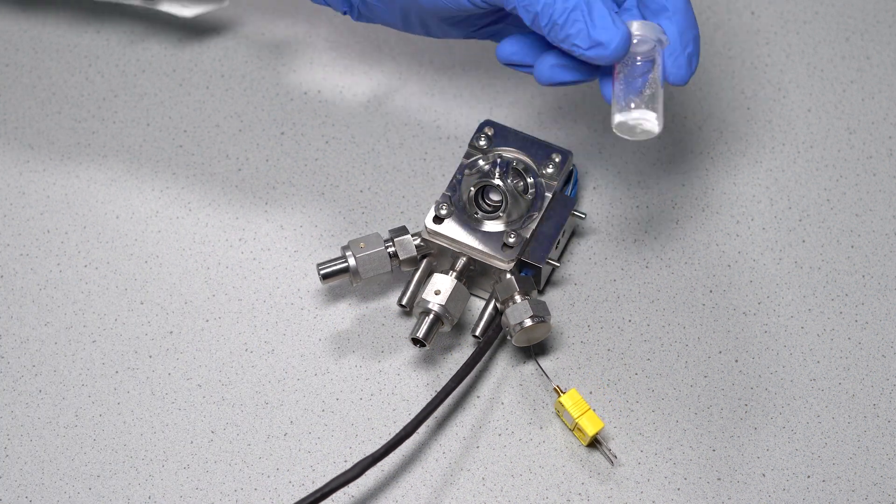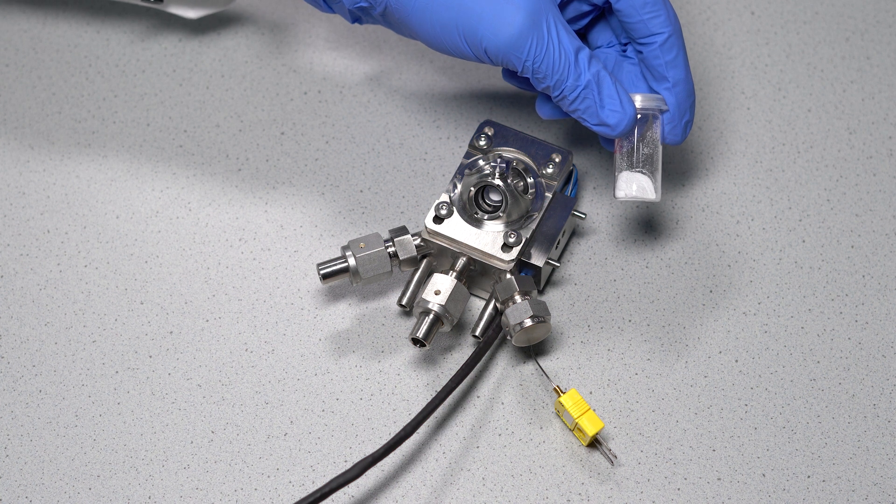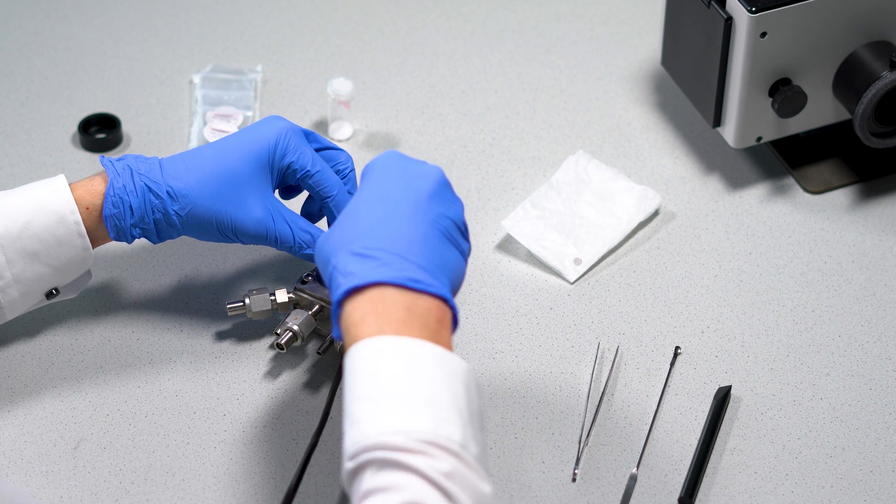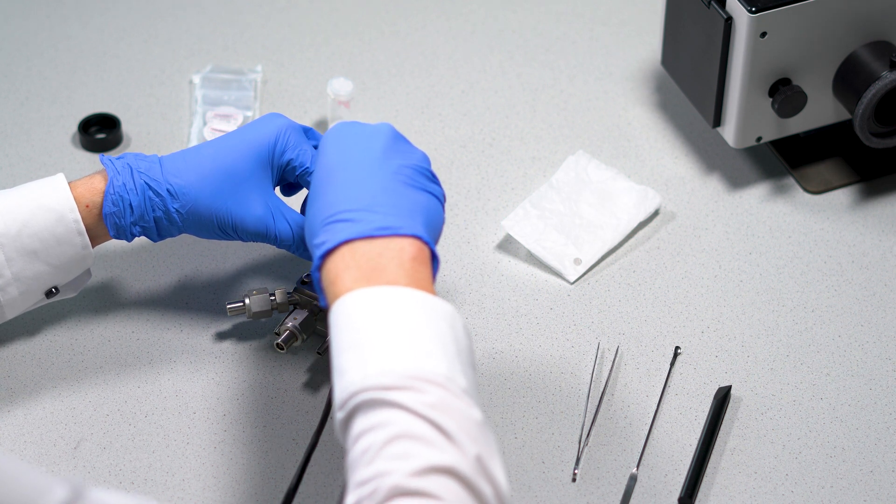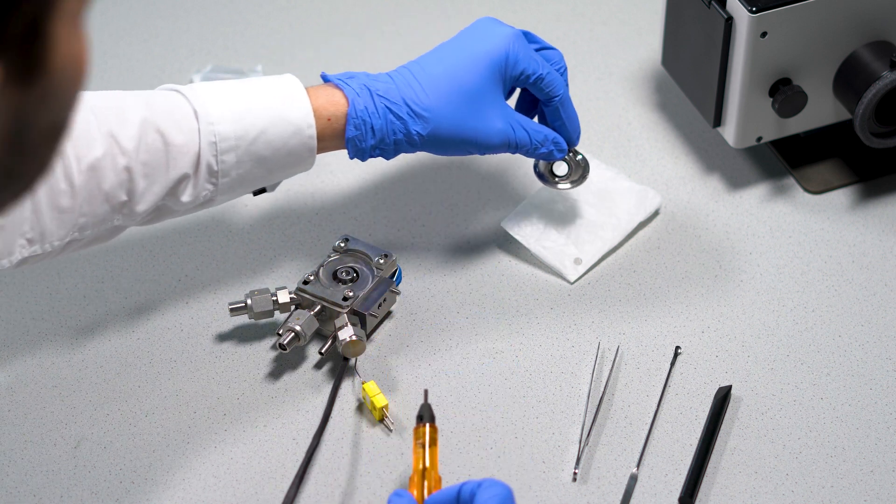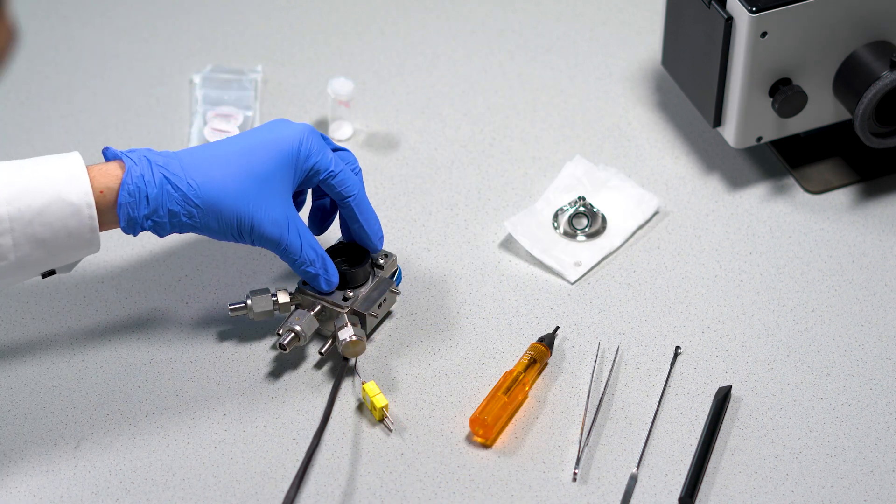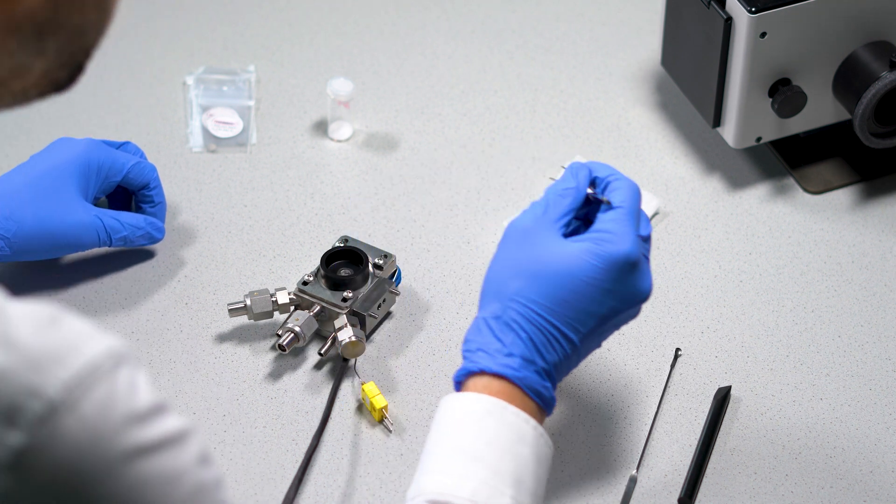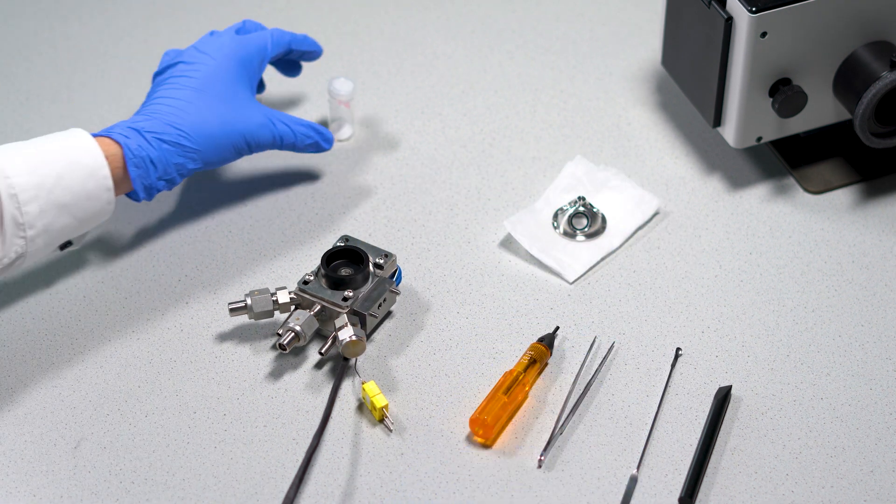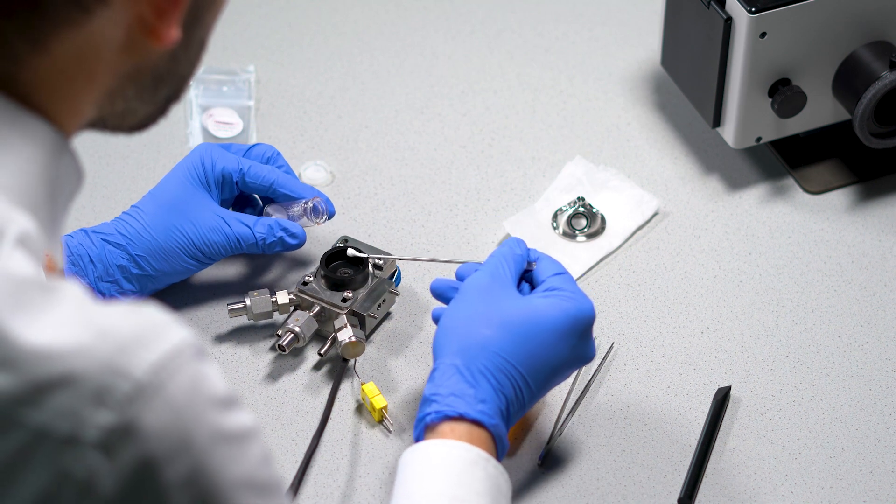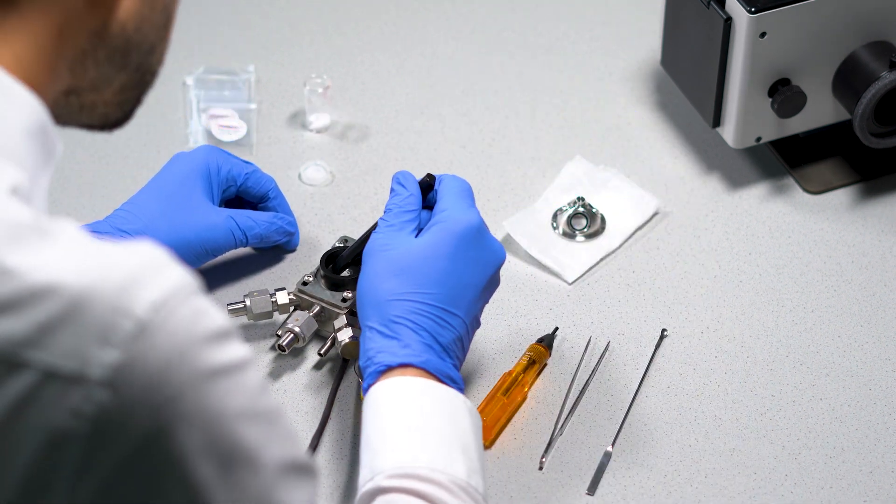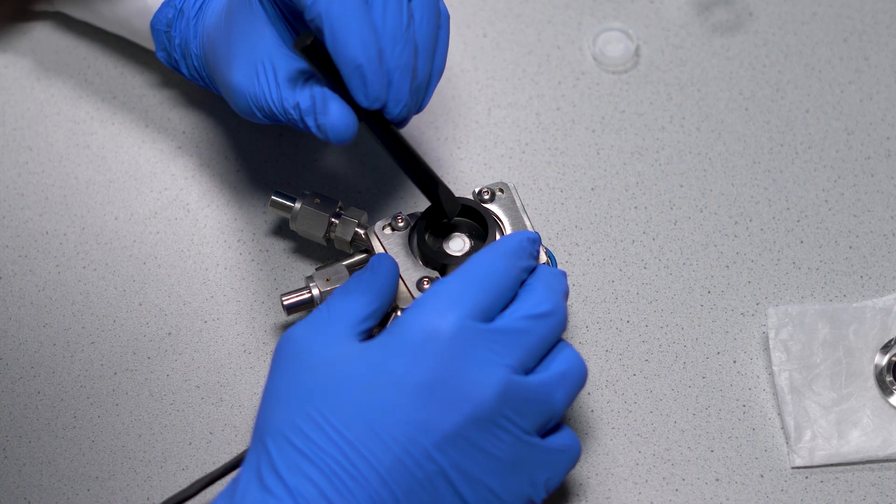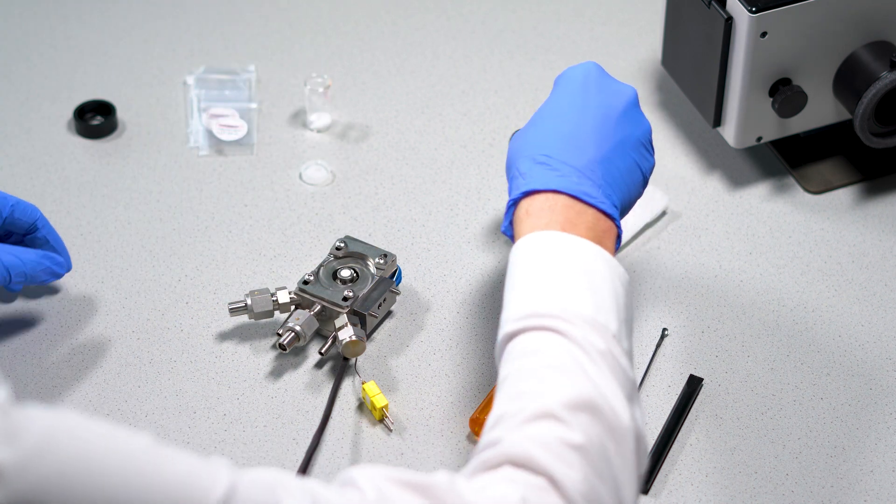And here is our sample: Calcium Oxalate Hydrate, a powdered salt with bound crystalline water. Inserting this or other samples in powder form is simple. Open the sample dome, place the filling guide around the sample cup, insert the metal grid into the sample cup, and fill it with the sample. Brush off excess material with the spatula. The sample surface must be even across the entire surface area. Remove the filling guide and mount the sample dome.